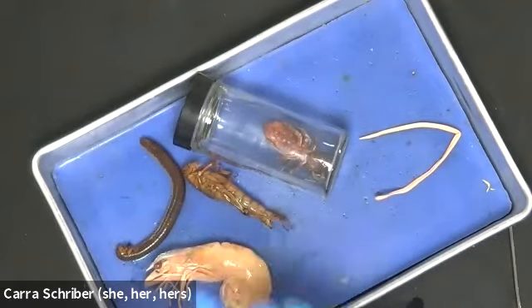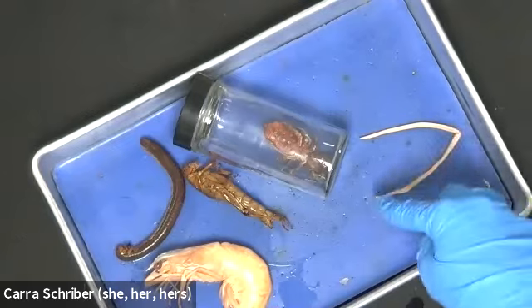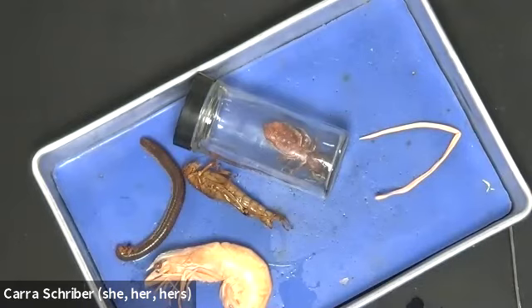But all of these arthropods are coelomates, meaning that they have a true coelom formation, unlike our roundworm. So if you remember, our roundworm had what? Our roundworm had a pseudocoelom, but these arthropods have a coelom. And so what happens with the coelom is that you have complexity.